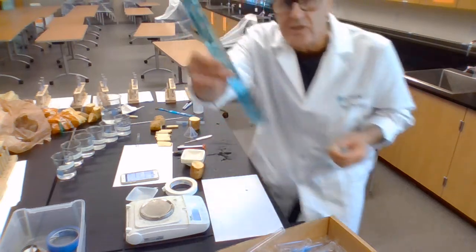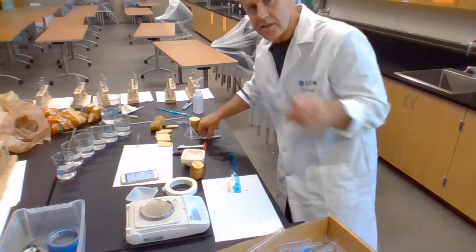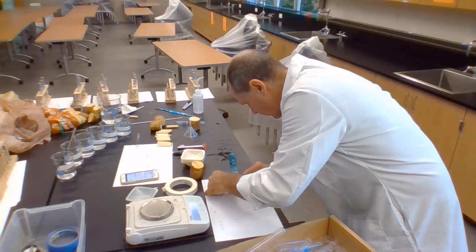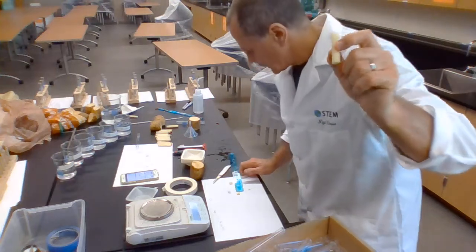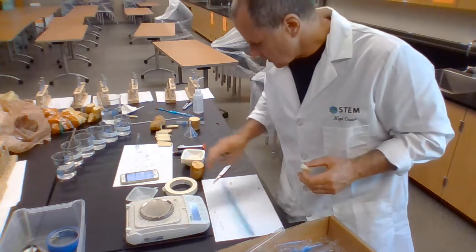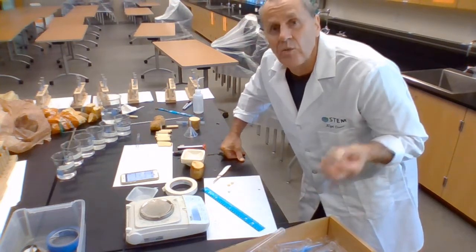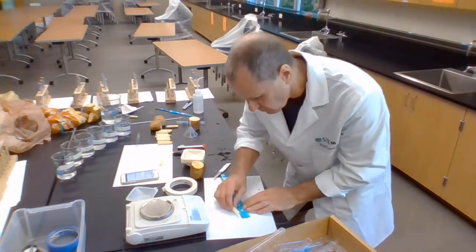And then I use this quite precise ruler to the nearest millimeter and I cut it using my tiny knife that I do have to almost exactly 5 centimeters. Now I can do this really well. That's quite precise. It's obviously a measurement uncertainty of 0.5 millimeter, so it's 50 millimeters plus or minus 0.5 millimeters every cut I do, which is like a 1% error, a 1% measurement uncertainty, which isn't bad. So now I've got this, and I'll do a couple more.